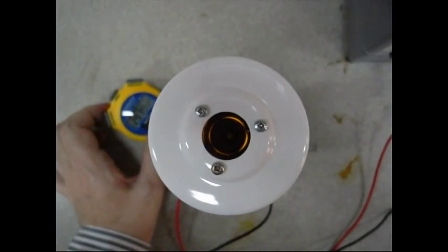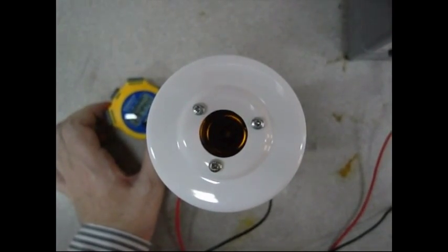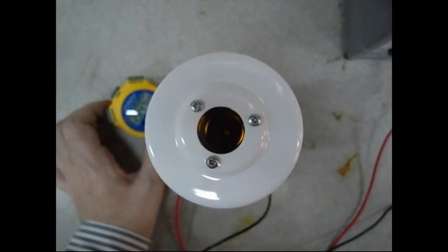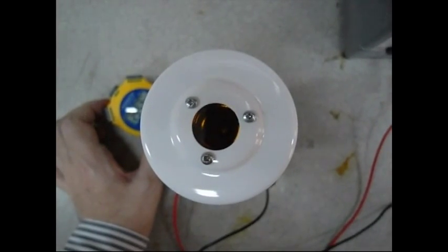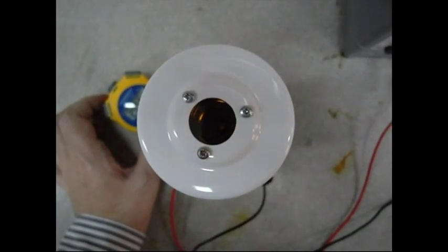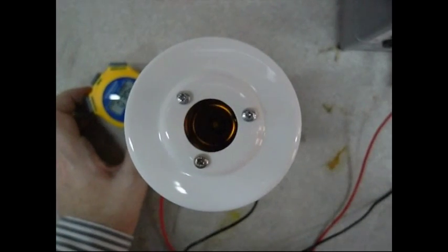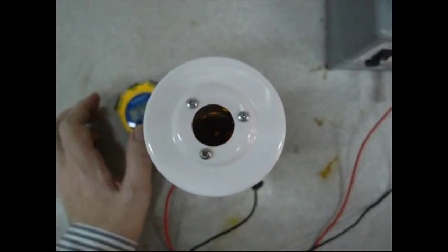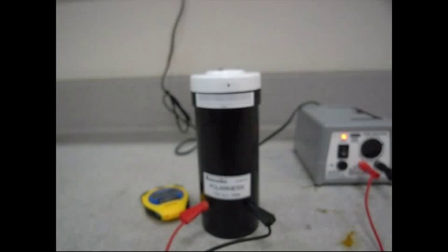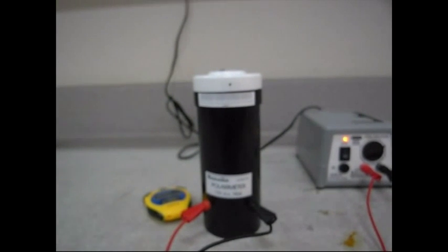Just coming round to 30 minutes. Looking down through the polarimeter, there's very little change since 20 minutes — very little light seen at all. That means the polarimeter reading hasn't really changed in the last 10 minutes. At 30 minutes the reading is the same as before, about 54 degrees. We'll take that as the last reading of our experiment.